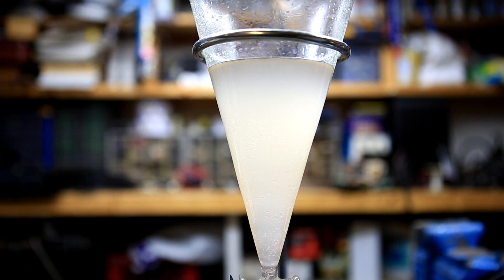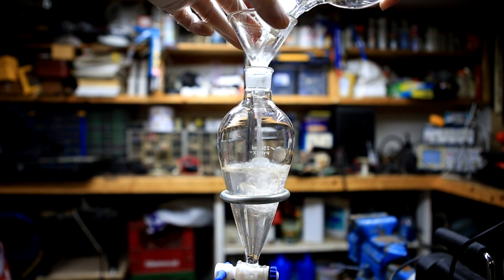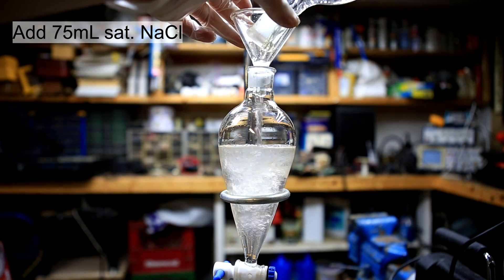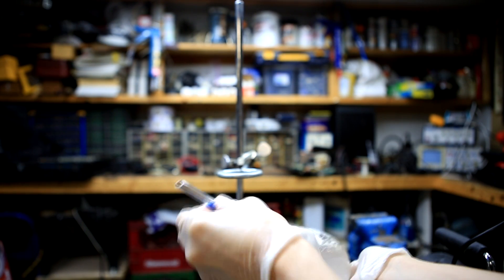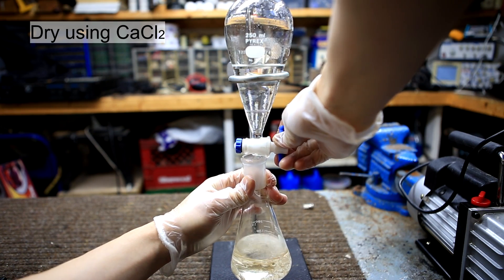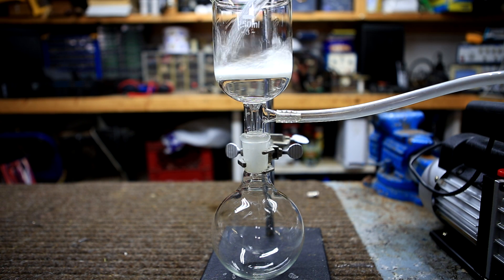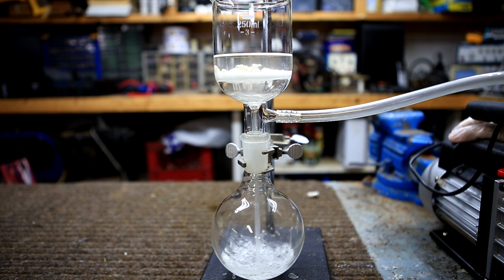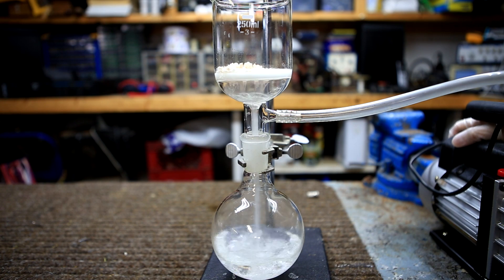After the extractions, the water layer might be cloudy and white, but that's fine. The extracted DCM layers were transferred back into a 250 milliliter separatory funnel, and 75 milliliters of saturated sodium chloride solution was added. The purpose of this step is to dry the DCM by osmotically pulling the water into the aqueous phase. The lower DCM layer is then drained into calcium chloride to further dry it. The mixture was swirled and let stand for several minutes, then filtered directly into a round bottom flask. The calcium chloride salt at the bottom is washed with a small amount of DCM.